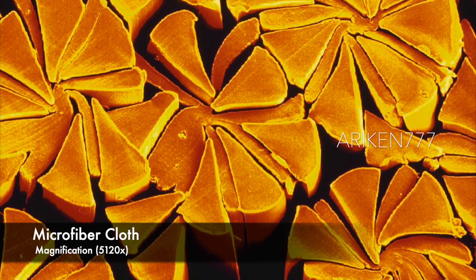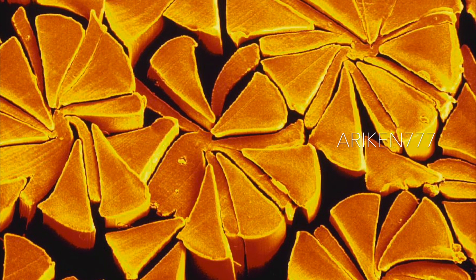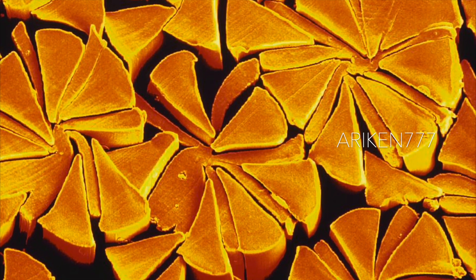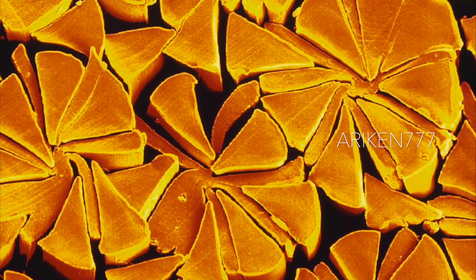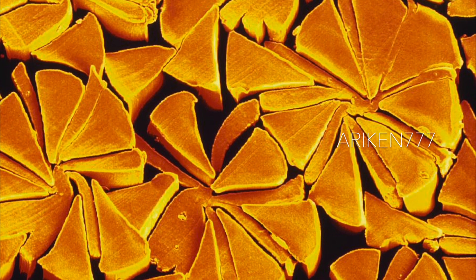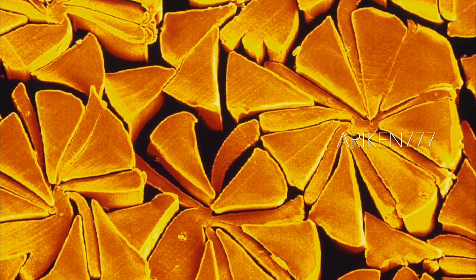A synthetic microfiber cloth used to clean spectacle lenses. This nylon-polyester composite contains bundles of extremely thin fibers that are partly split into individual strands. The wedge-shaped fibers are so thin that they can scoop up the fine layer of oil and dirt that accumulates on lenses, unlike other fabrics which merely spread the oil around. Their soft texture also prevents scratching, making them suitable for polishing coated plastic lenses.